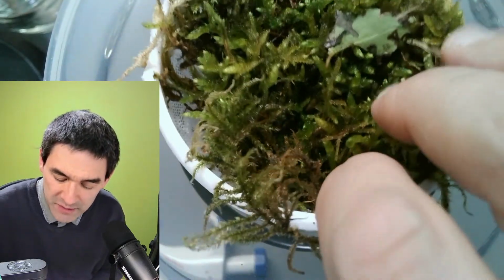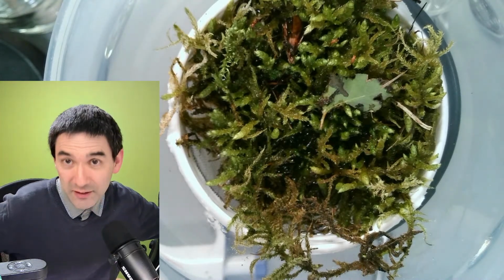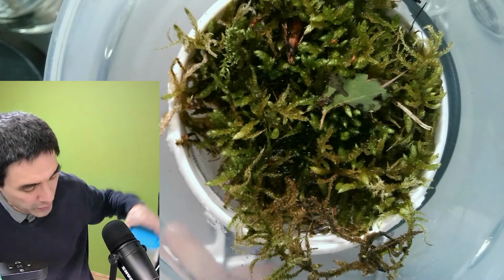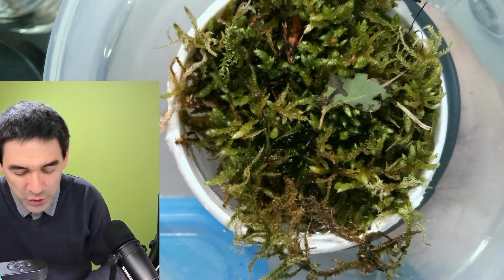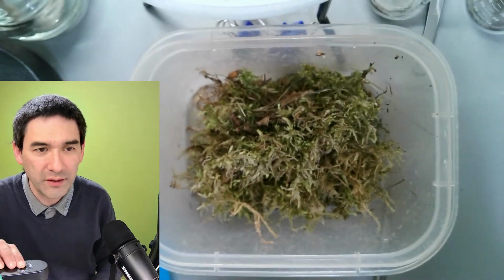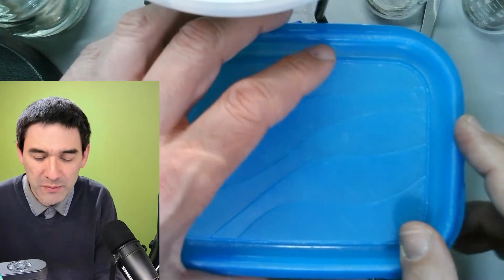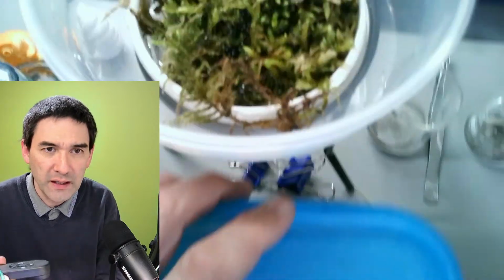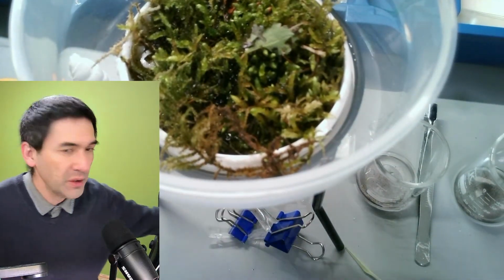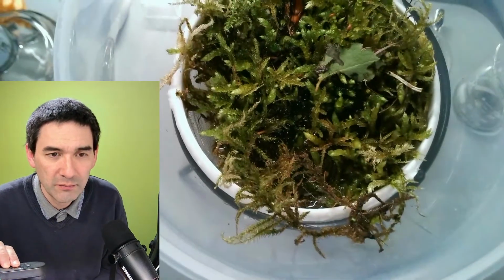So I just want to show you now, I put this back in. You see that actually the moss looks kind of green now. I collected it just today in the morning. Right now where I am, it's evening, but I just want to show you the original, how it looks originally. This is the original one, which I collected. So it's quite dry, and you have to give it a couple of hours maybe for it to soak up sufficient liquid, so that all of the microorganisms and microanimals kind of come back to life. Yeah? And so that's basically how it looks.